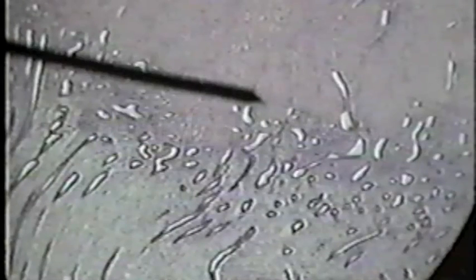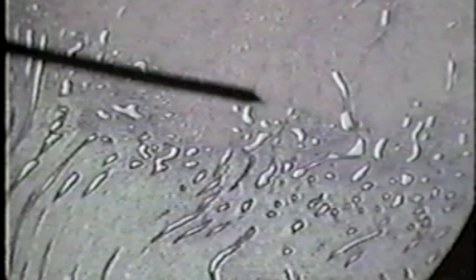The pointer here is situated between the endometrium of the uterus and the myometrium. The myometrium is above the pointer and the endometrium — the layer that sloughs off monthly — is below the pointer.